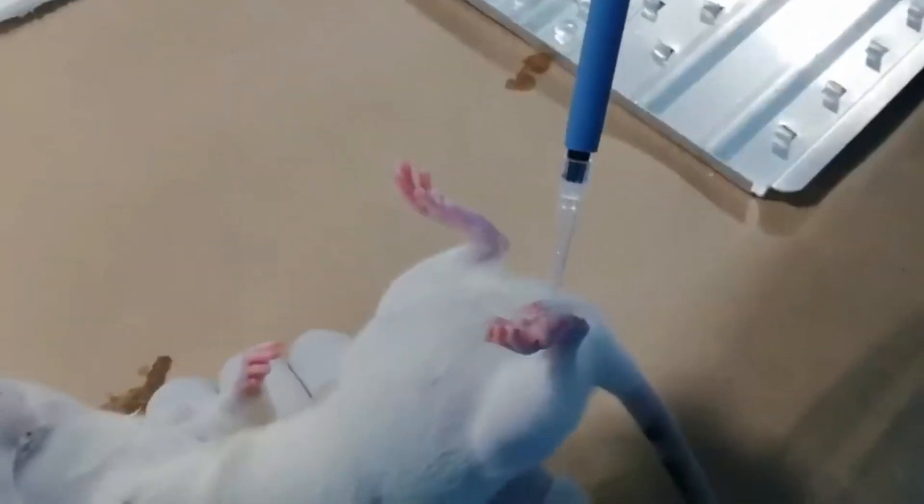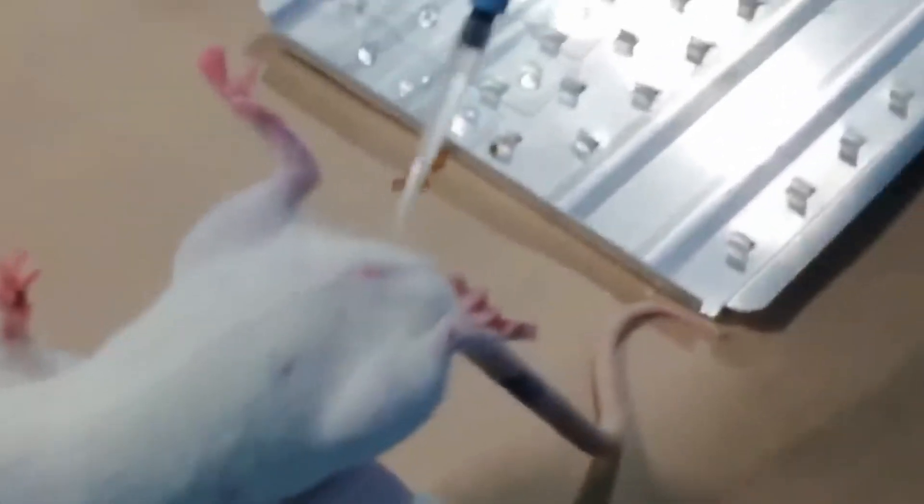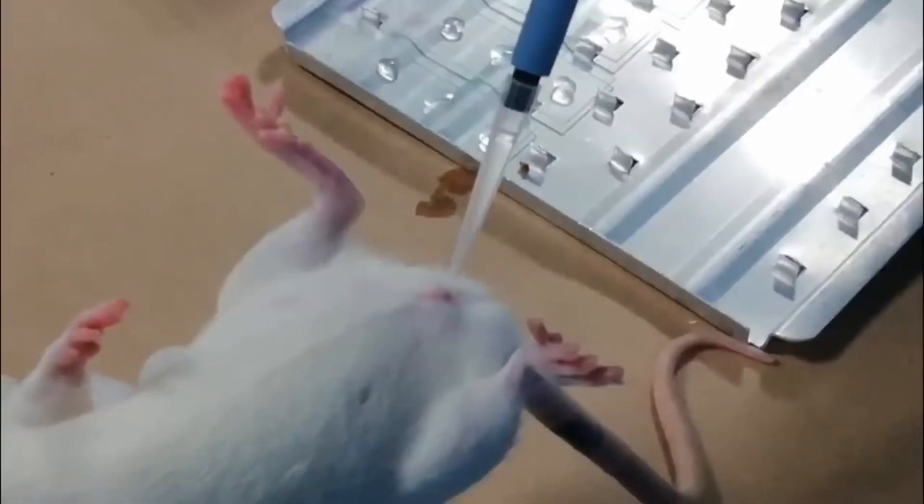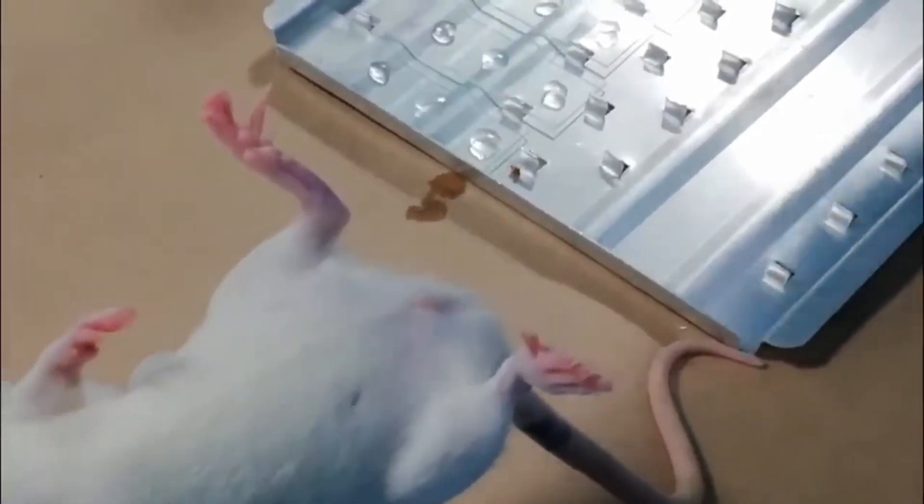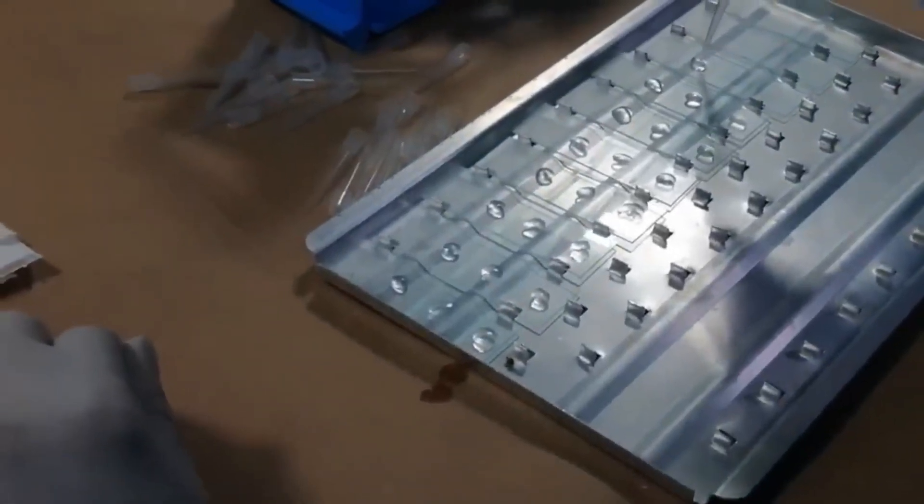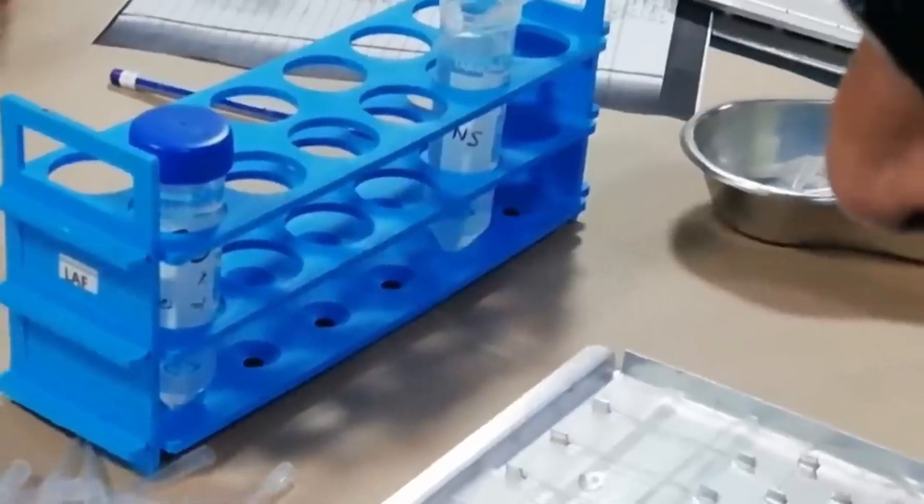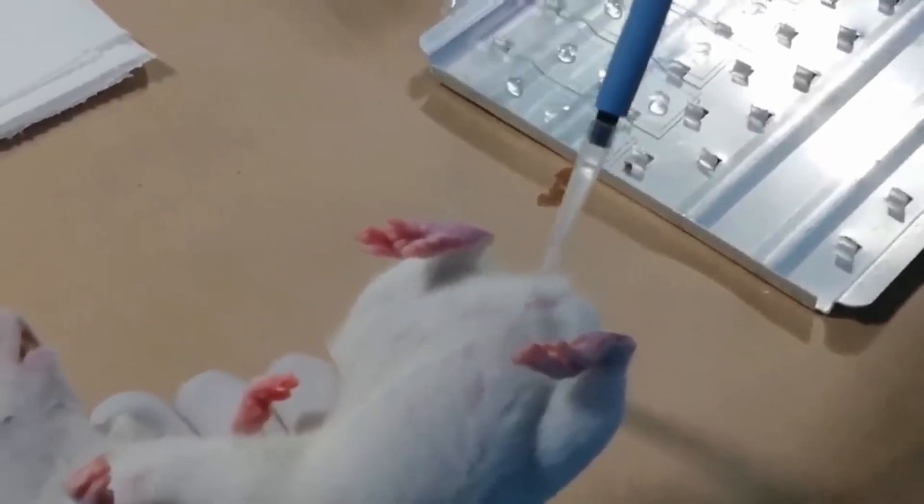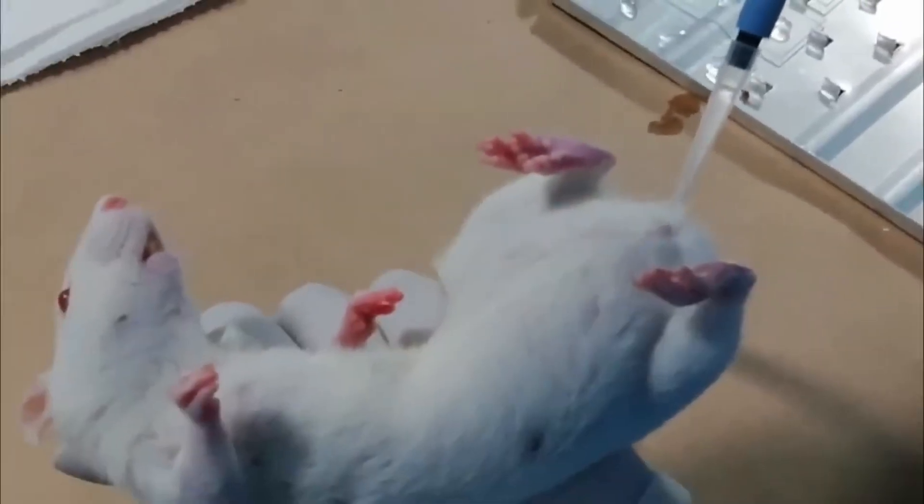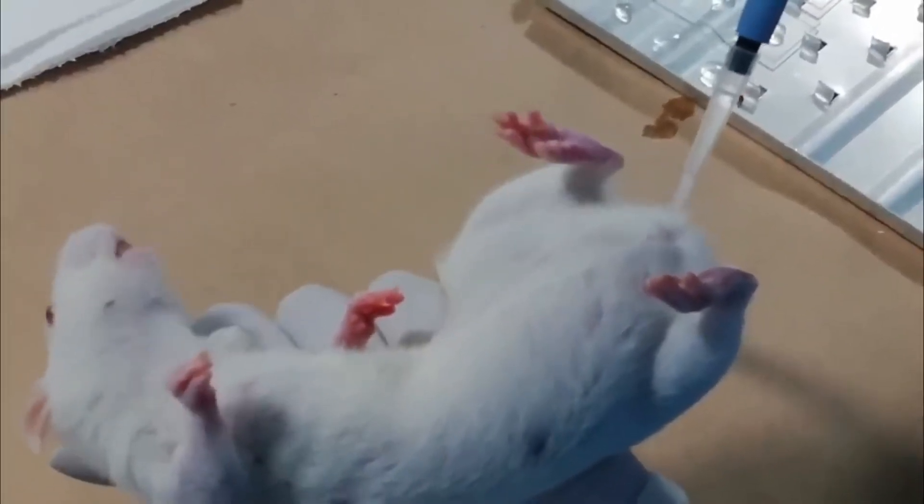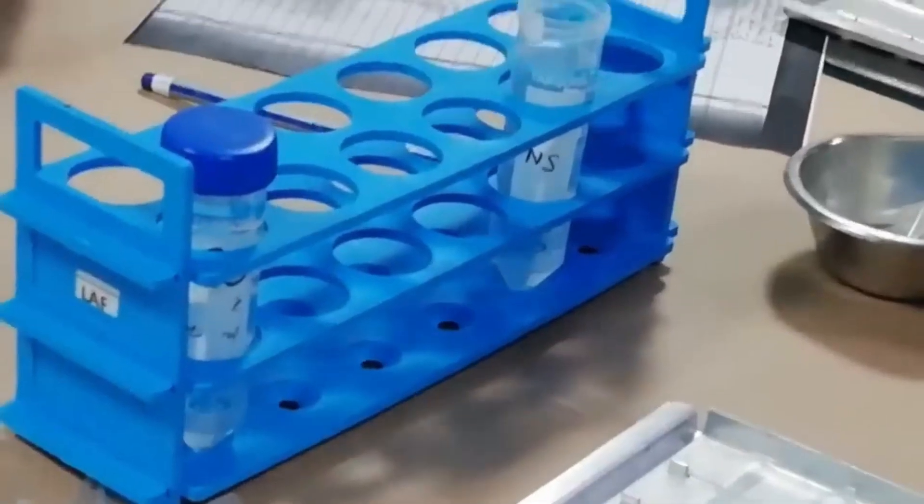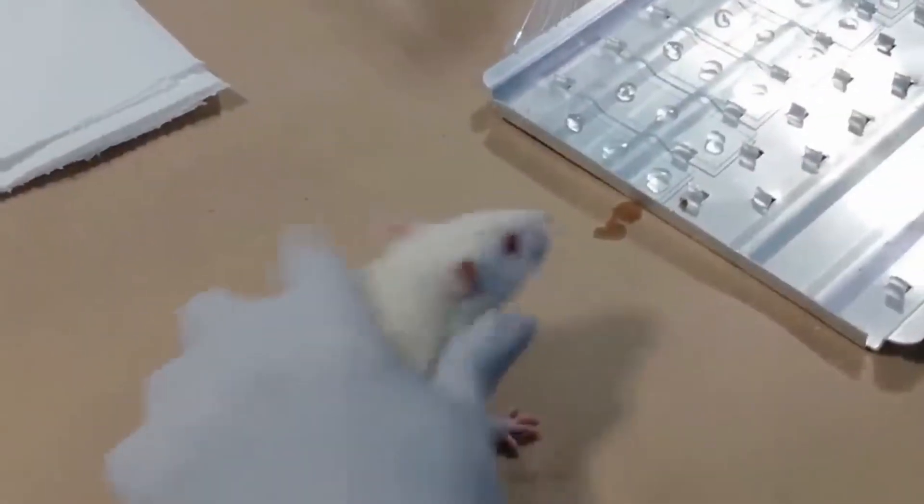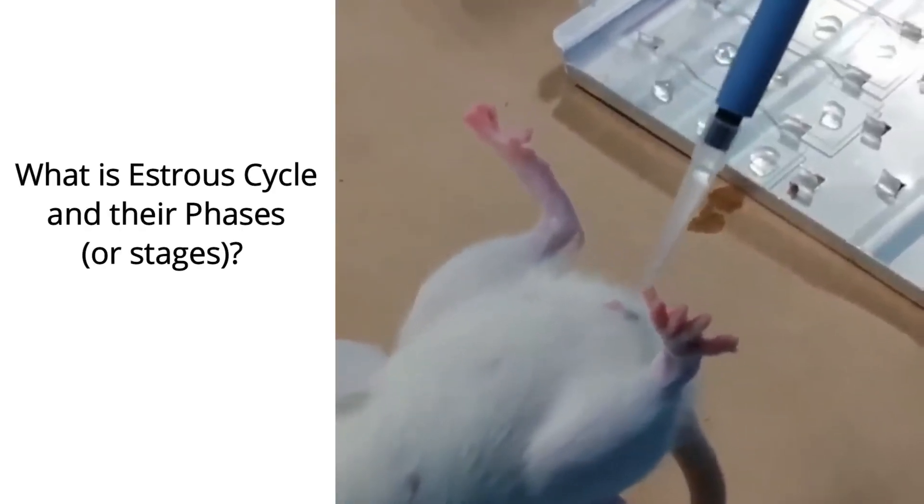Here you can see we are collecting the female rat's vaginal smear. This is the procedure: in the micropipette we have taken normal saline that we are adding inside the vagina and washing the vagina through normal saline using micropipette. We are collecting this smear on slides that are already numbered. As per the numbering of the animals, we have numbered the slides. On one slide we are taking three animals' smear. This is how we can collect the female rat's vaginal smear.